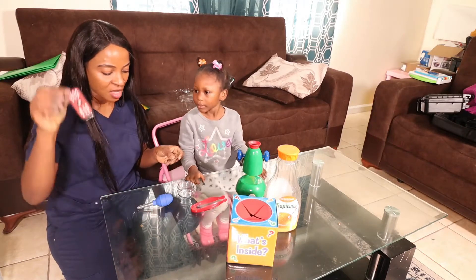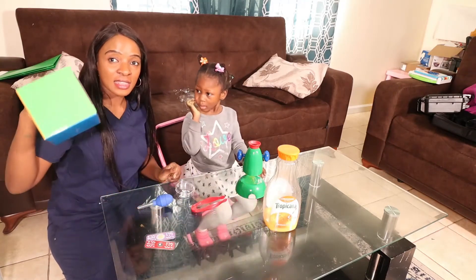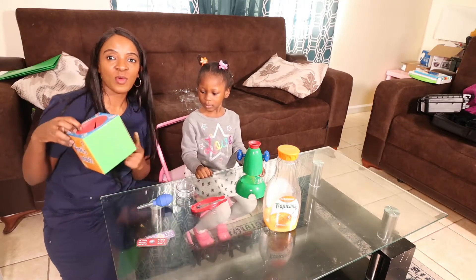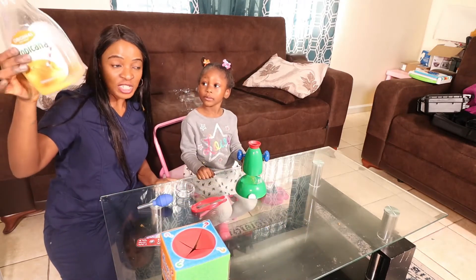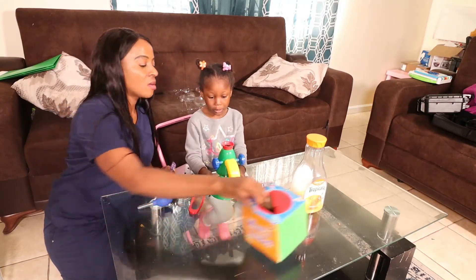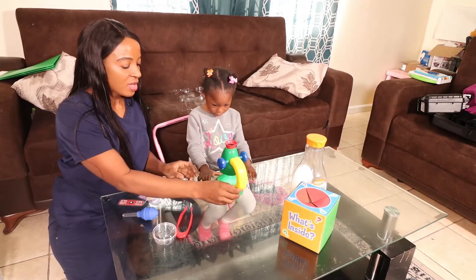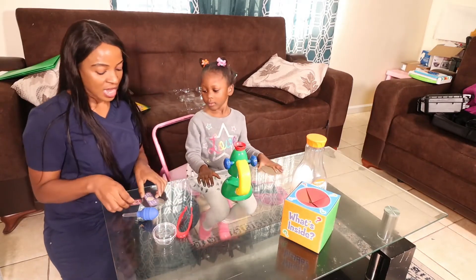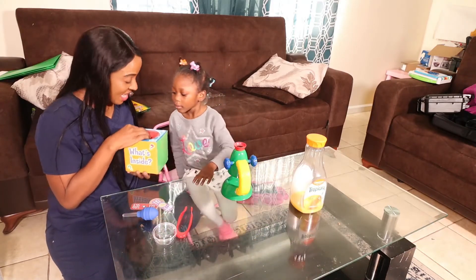We have our slides — two prepared slides, one is paper and the other is a cutting. We have our question box where the fun things are inside; we're going to use the box for predictions. We have our orange juice, and I'm going to arrange the materials on the table so we can use our microscope to start our experiment.